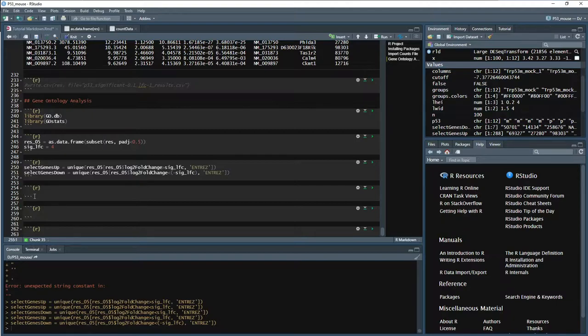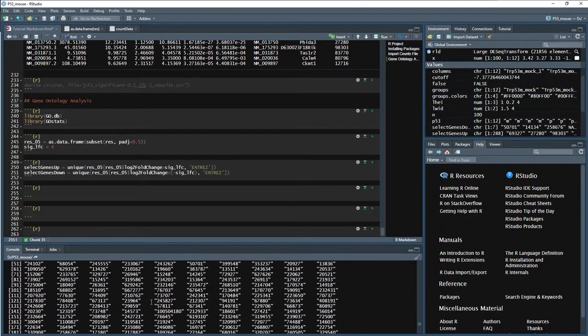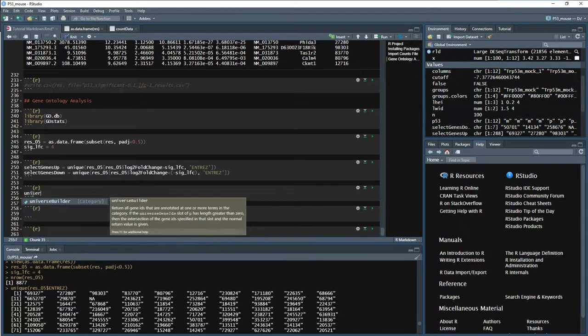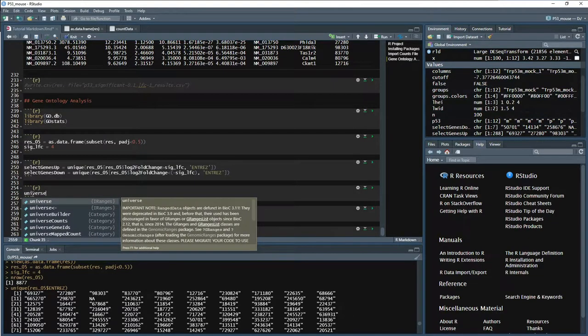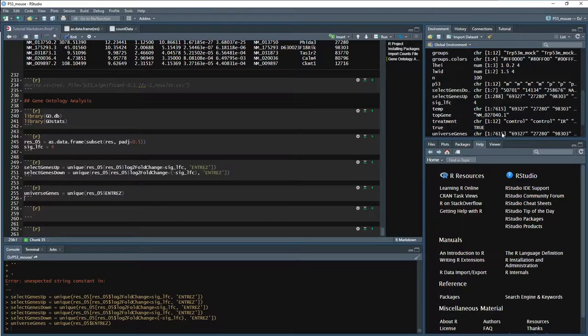Now we need what the Hyper-G test calls universe gene IDs. So we can do that by, well, we already gave an example of that. Basically, we want all the unique ones here. So if we just copy this, we'll give it the same name that they use. So universe gene, we'll just go genes equals unique. There we go. So we have the unique Entrez IDs. Awesome.